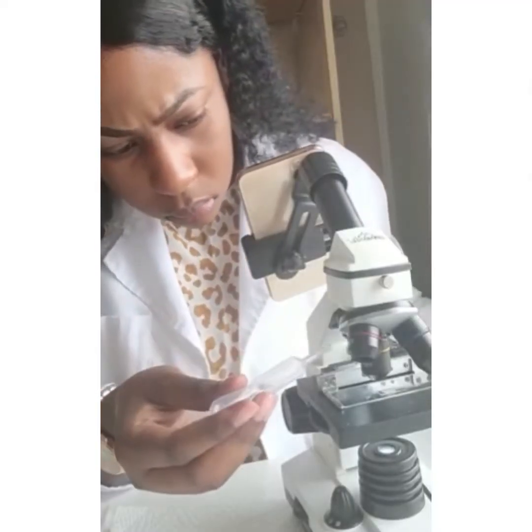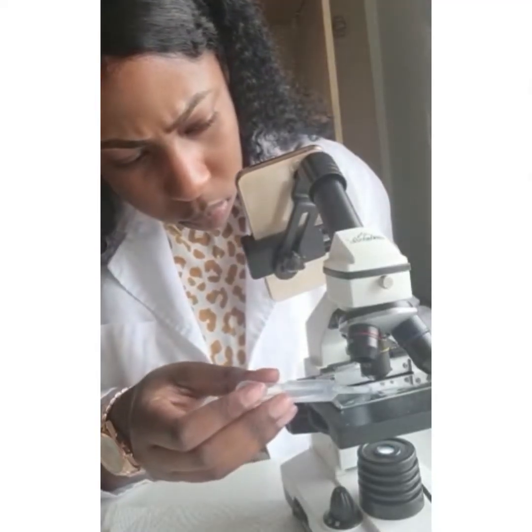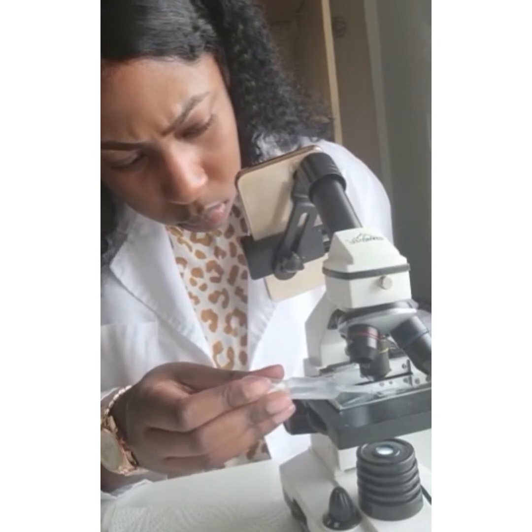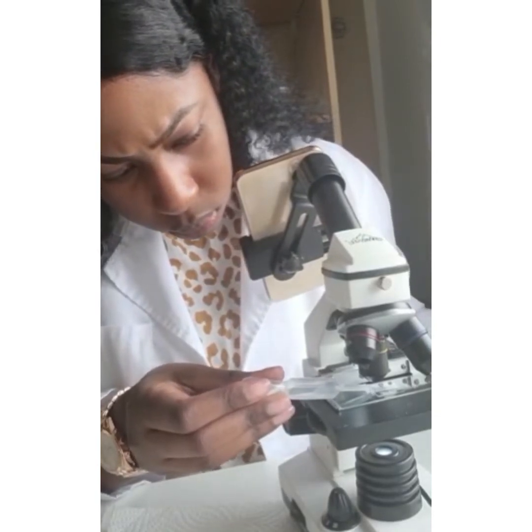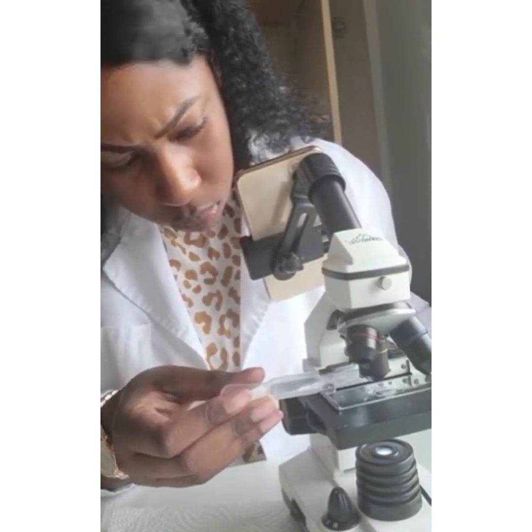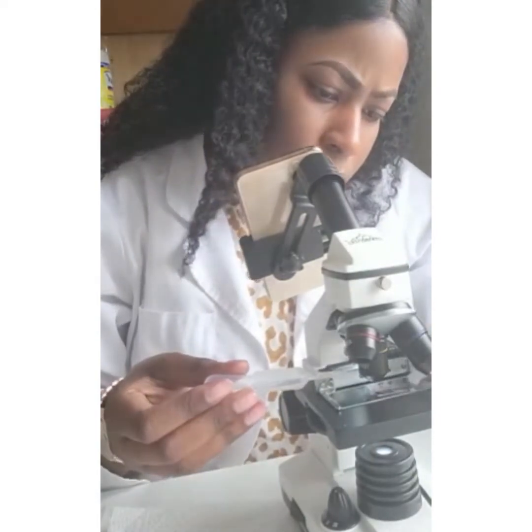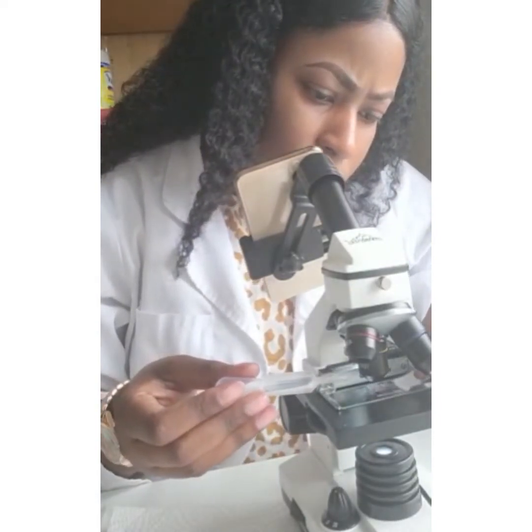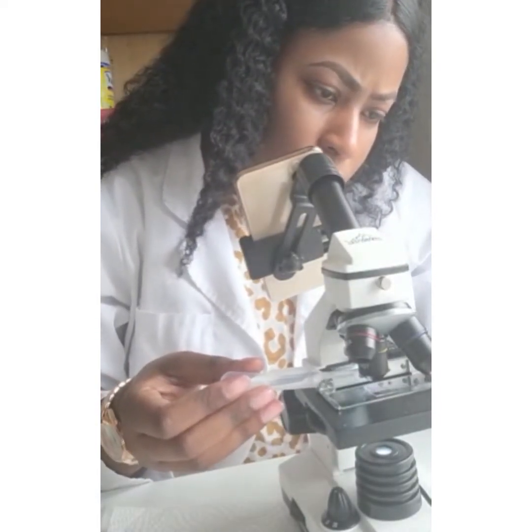Now I'm going to be adding two to three drops of concentrated salt solution to one side of the slide specimen, and I'm going to use a filter paper to pull that concentrated salt solution to the other side.